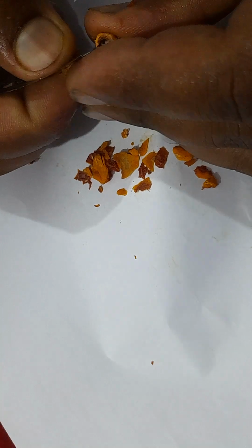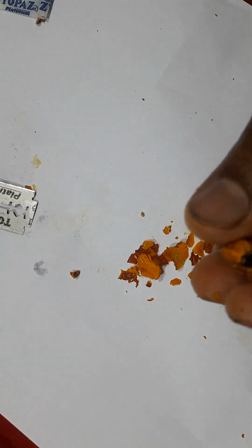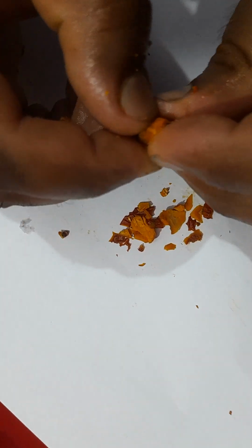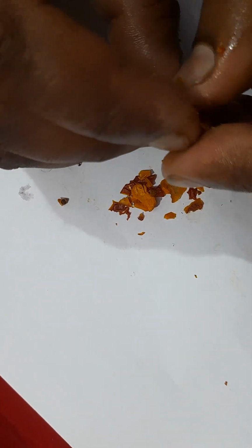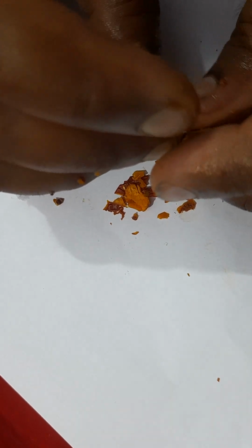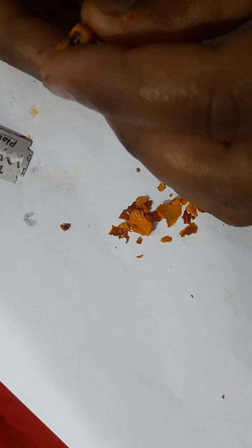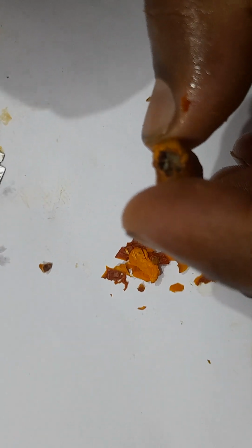Okay, so here inside, if I can break this, here you can see the dried covering. It is due to this stony layer that it's very difficult to cut the ovule, right? But anyhow I could show you, you can see the inner layer is also there. If you can focus here, the inner one is attached with the female gametophyte, right?